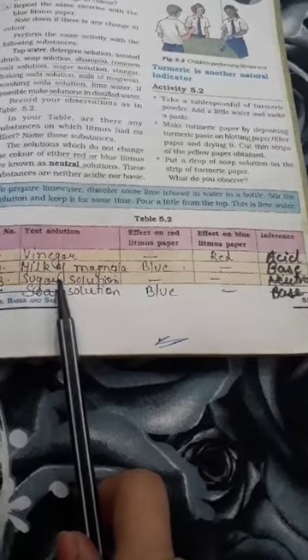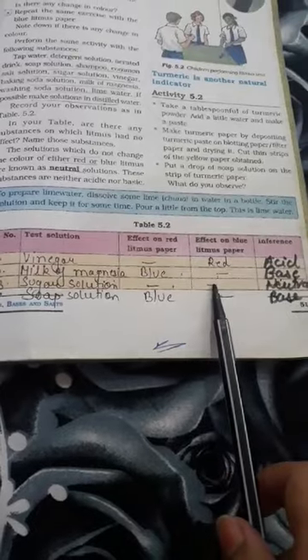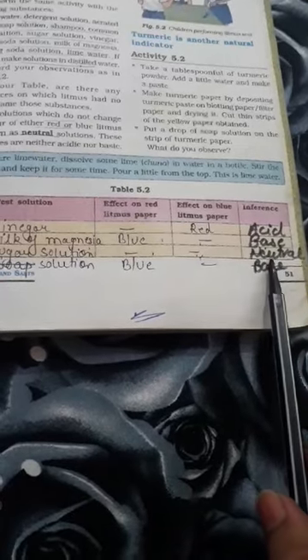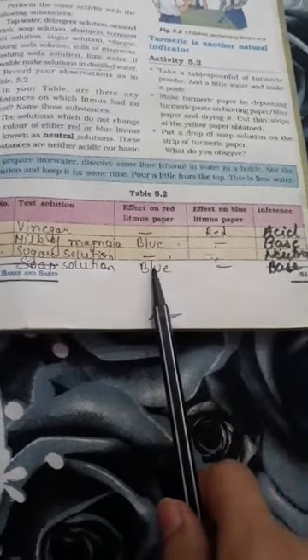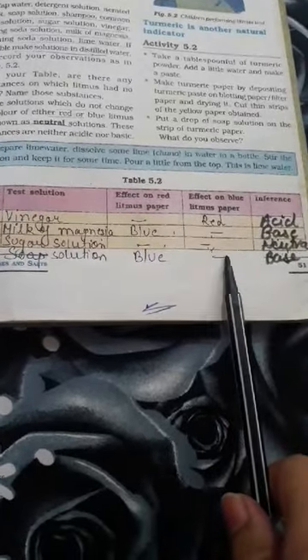Then we have sugar solution. Sugar solution is going to show no color change with red as well as blue litmus paper — there is no color change, which means it is neutral in nature; it is neither acidic nor basic. Then we have soap solution. It is again going to turn red litmus to blue, and with blue litmus paper it is going to show no color change. Solutions which turn red litmus to blue are basic in nature.